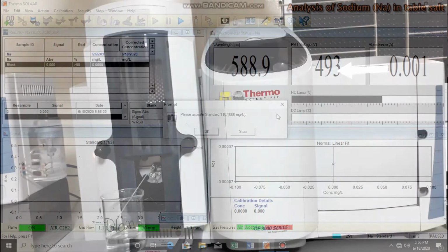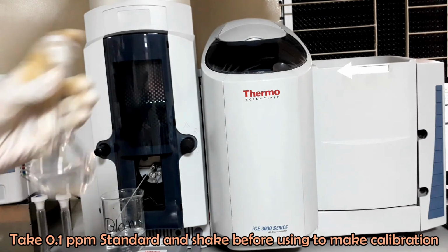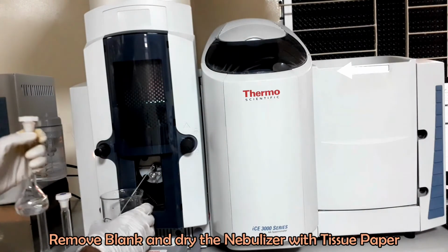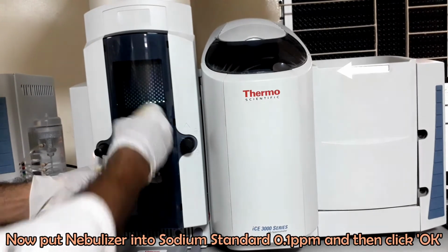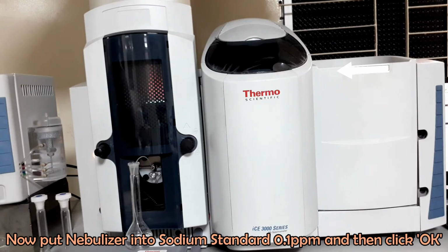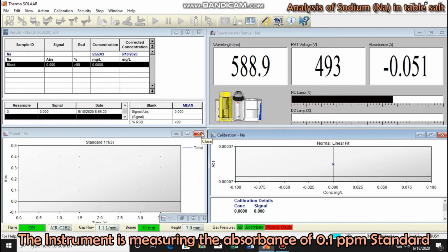Now the instrument is asking for 0.1 ppm sodium standard. Shake the standard flask. Dry the nebulizer and replace the blank with 0.1 ppm sodium standard. Click on OK. The instrument is measuring the absorbance of 0.1 ppm standard.